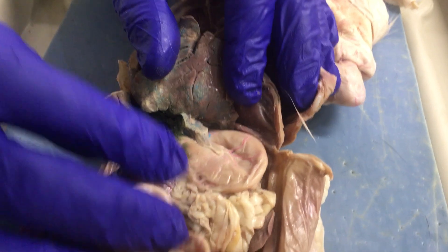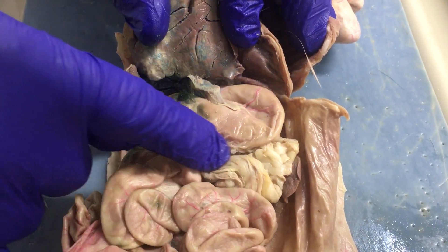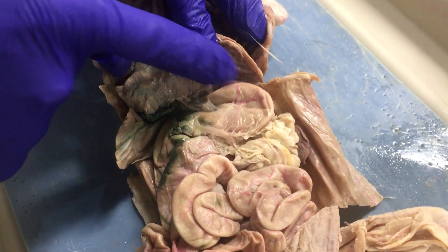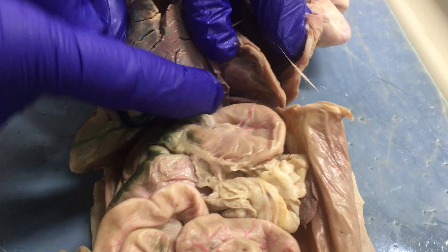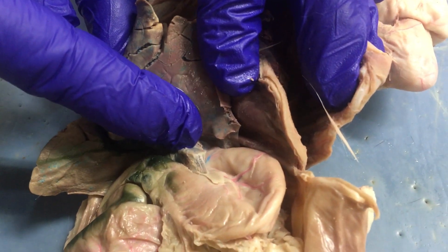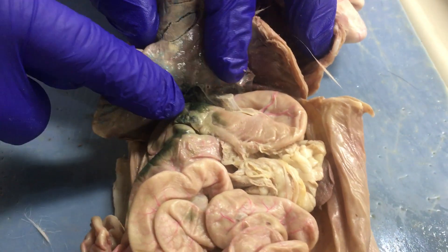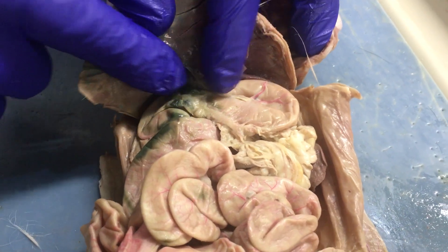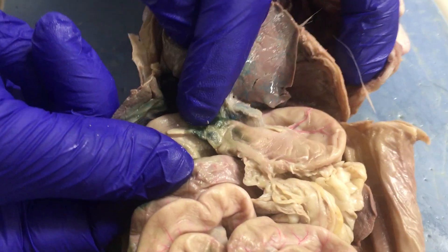The stomach is over here. It's shaped like a U. You can see the greater curvature and a little lesser curvature. The large fundus and the narrow pylorus. Cardia would be way up here where the food enters. The pylorus here ends at the pyloric sphincter, which is right about there. You can see the small intestine begins right here.